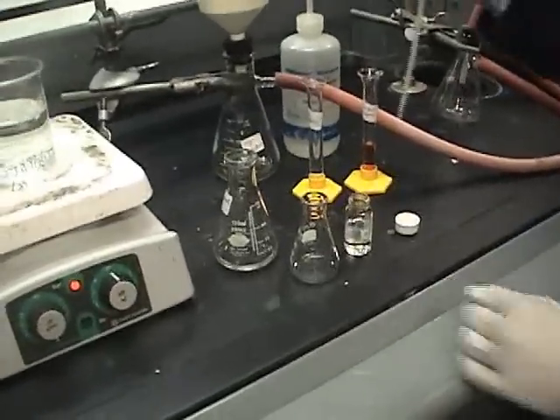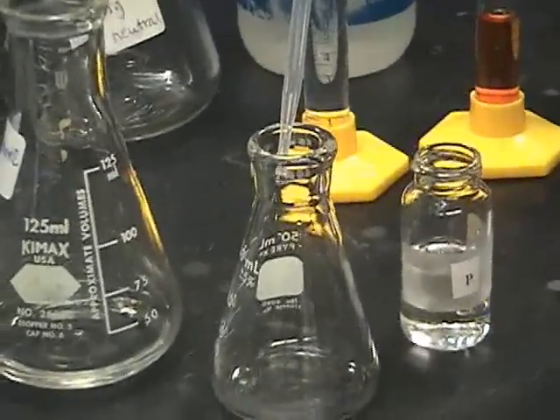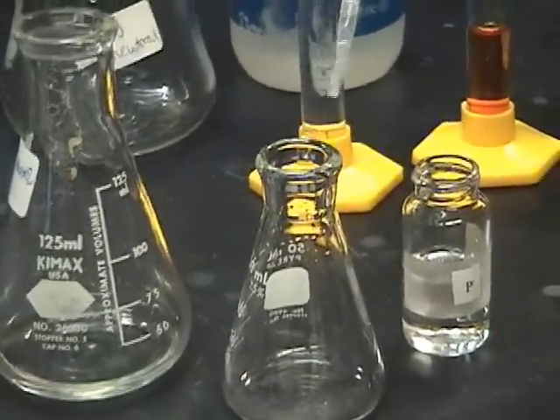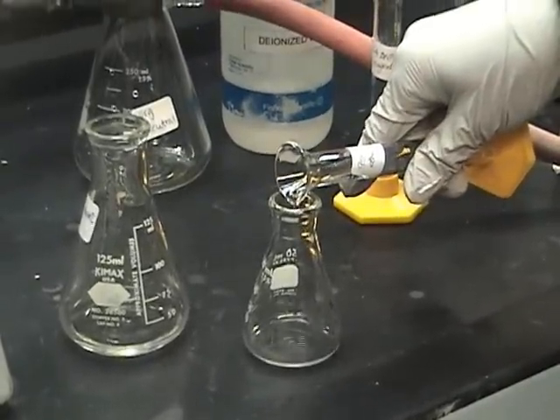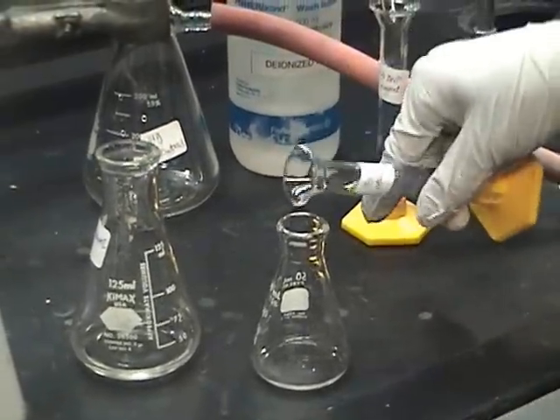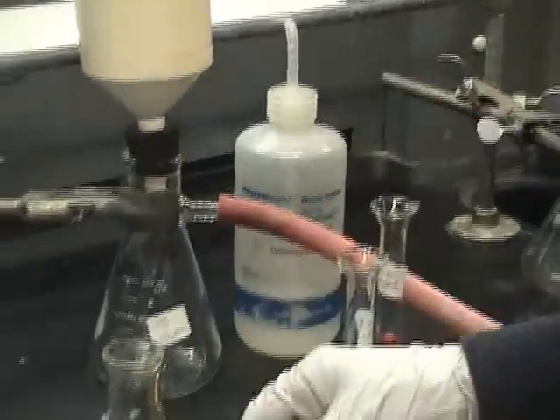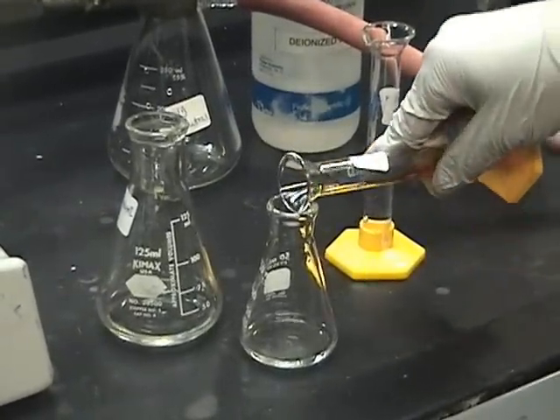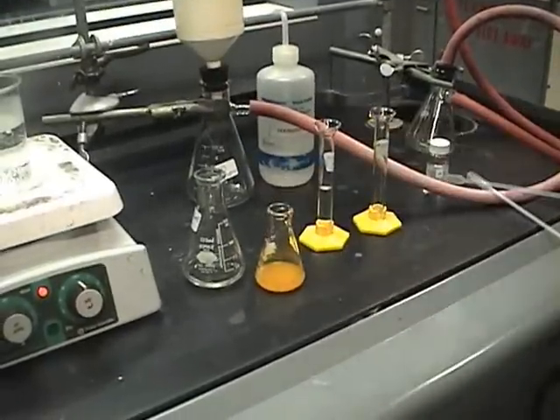For the DNP test, you are going to place about 30 drops of your unknown into a 50 ml Erlenmeyer flask. Then you dissolve it in a minimum amount of 95% ethanol, about 2–5 ml. Then you add 5 ml of your 2,4-dinitrophenylhydrazine reagent.